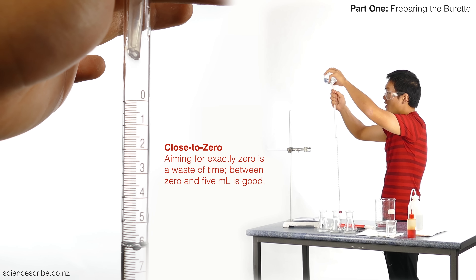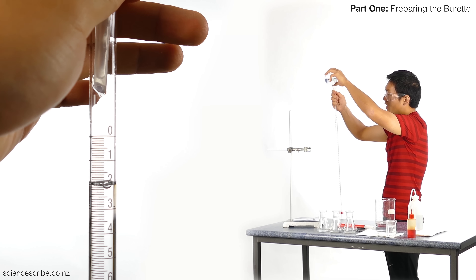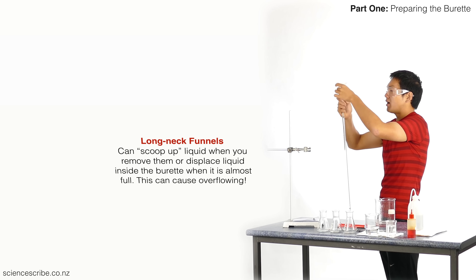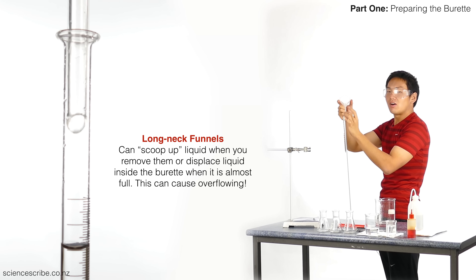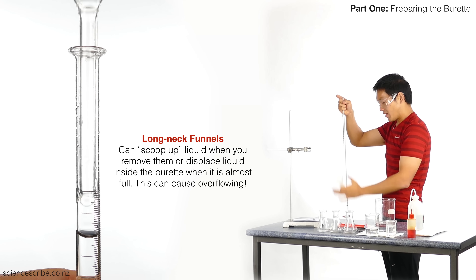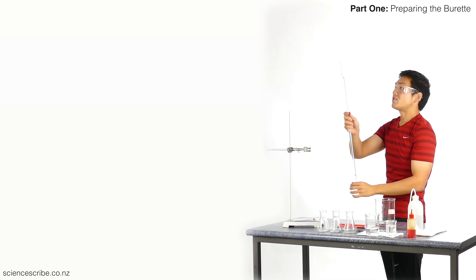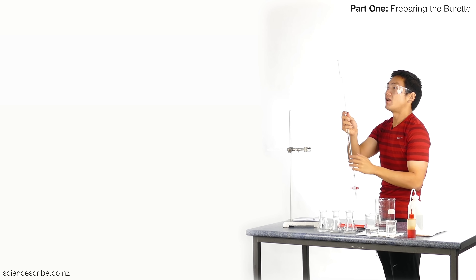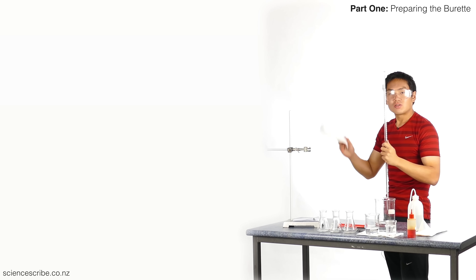The other risk is that sometimes with these funnels you get a really long neck. The reason that's a bit of a worry is that when you have a really long neck sticking out, sometimes a lot of liquid ends up being trapped in the funnel, and when you take the funnel out you end up getting a spill. The last thing we want is for this area to become wet and start dripping stuff all over the flask we're using during our titration.